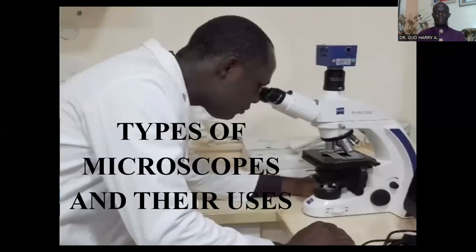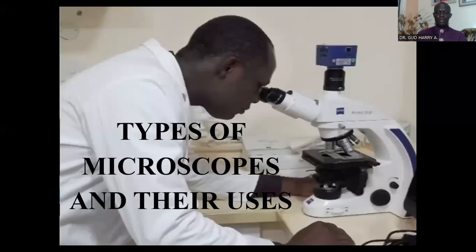Hello, you're welcome to Lectures on Biological Techniques. Today's lecture will be on the types of microscopes and their uses. We're going to look at the introductory part of different types of microscopes and their uses and summarily discuss them. Details will be discussed in subsequent videos of this series.